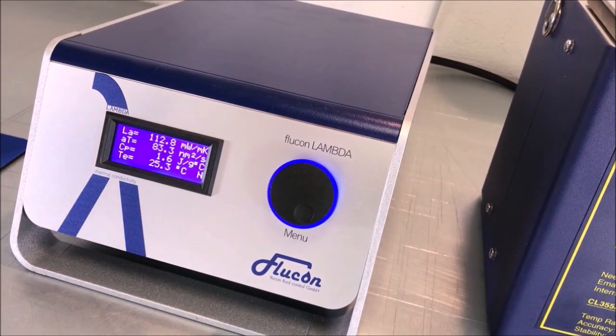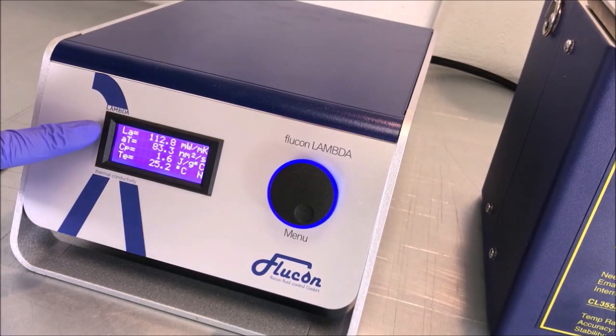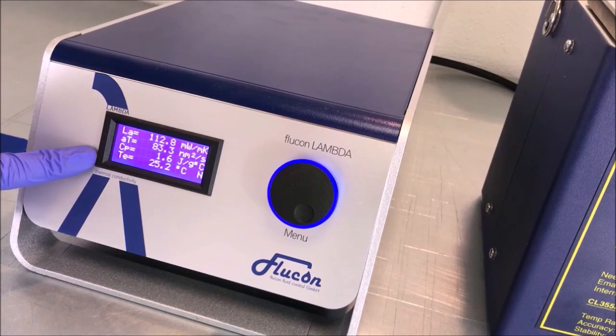After approximately one minute, the first measurement values will be displayed on the LCD of your Lambda meter.